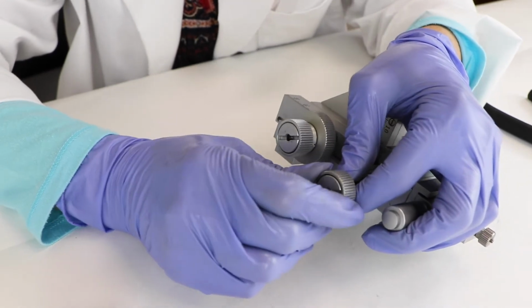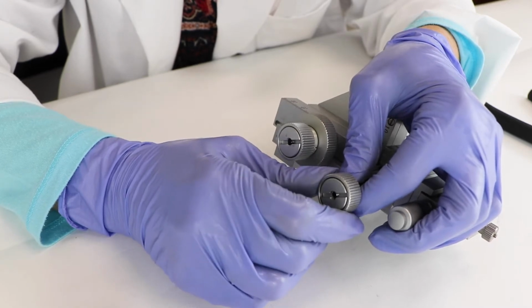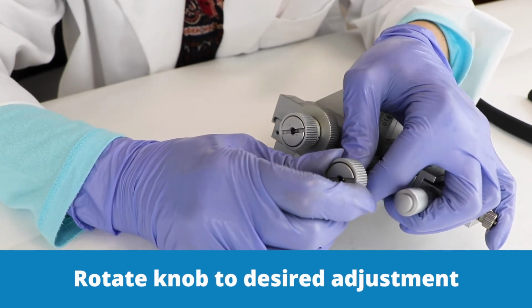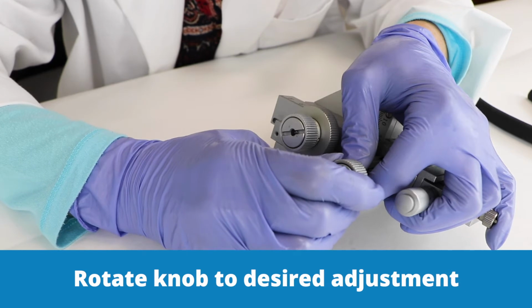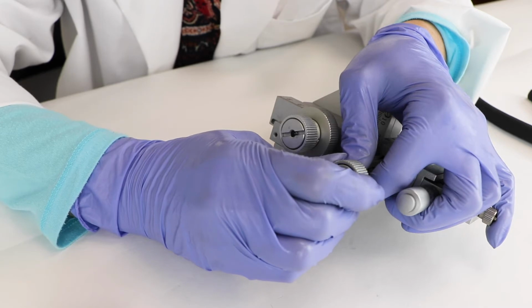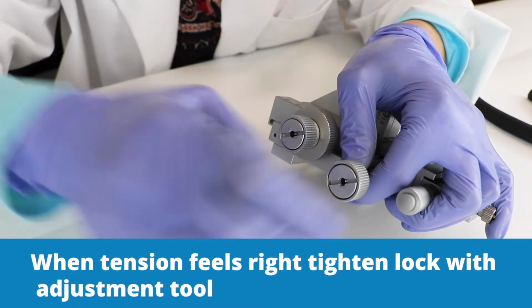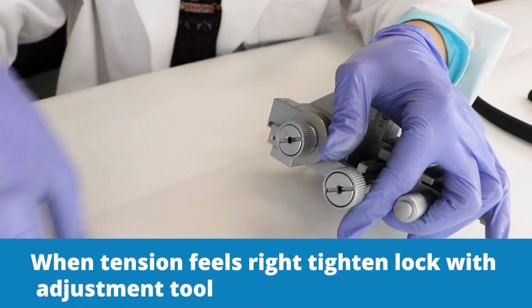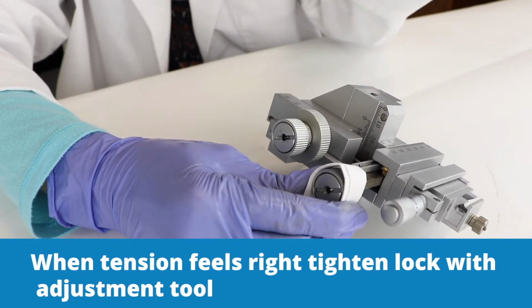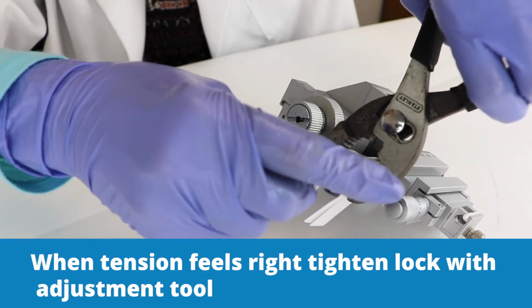Once that nut is loose, the silver knob will turn freely here, and we can adjust that outer ring to prevent the axis from moving while we're making the tension adjustment. And we'll hold this securely, and then we'll just rotate this until it's right where we want it to be. And you can feel the resistance of the knob inside as it compresses down against the steel spring and the nylon friction components. Somewhat arbitrary, but when the amount of tension feels about right, then you use your adjustment tool and your wrench and you tighten it back down.